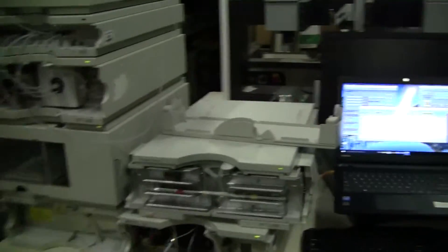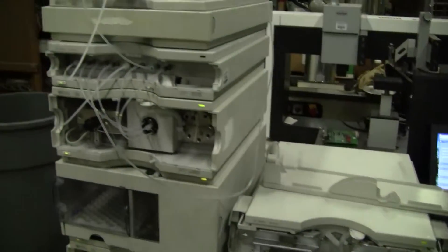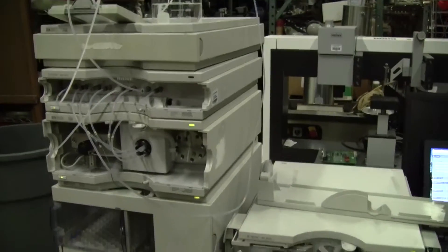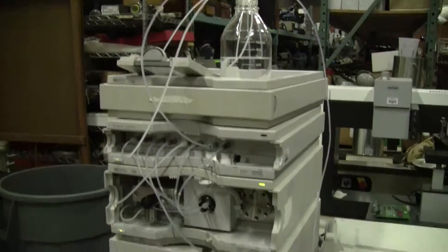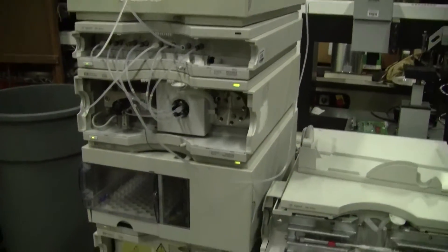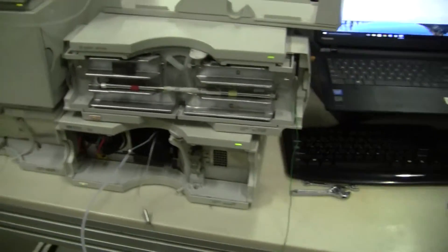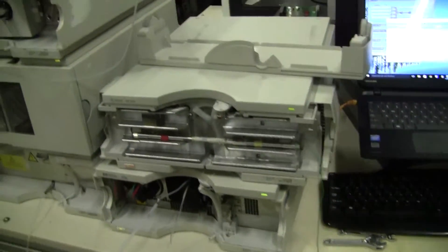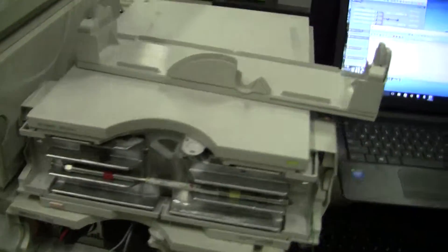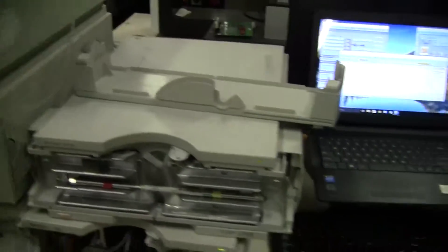Hi, this is Michael from Hi-TechTrader. Today we're looking at an 1100 HPLC system — degasser, quad pump, auto sampler, column heater, and a DAD detector. We have them hooked up through the Ethernet connections on the back.